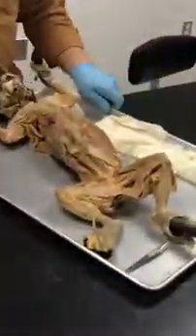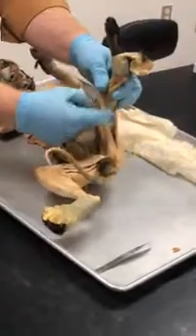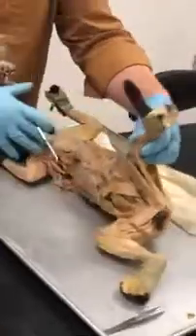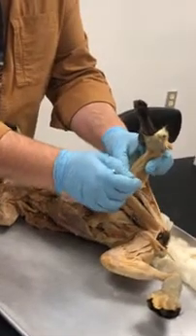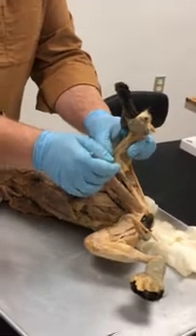Now, you have to visualize this, he's standing like this. I'm going to make it so it's kind of like upside down. You just get yourself oriented. So that's going to be lateral, of course, and this is medial. Okay? So when you look at this, from this view, it's going to look like this. What is this muscle here on the lateral side? Biceps femoris.